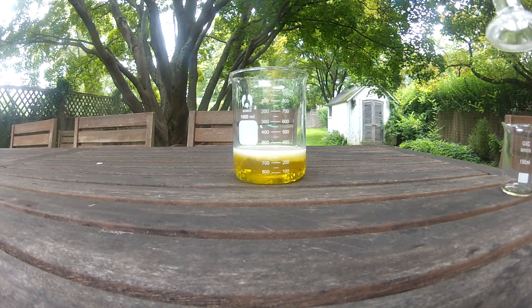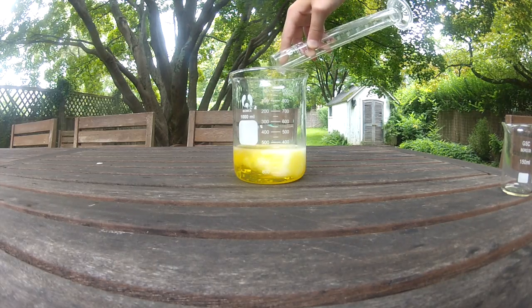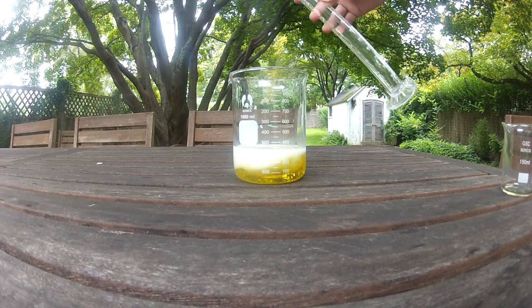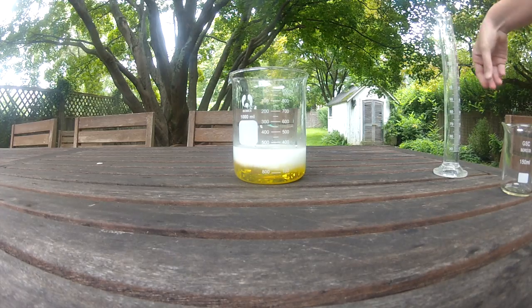Take the final solution and add it to a separatory funnel. Let it settle out for a couple of days and the bottom layer should be bromoform.